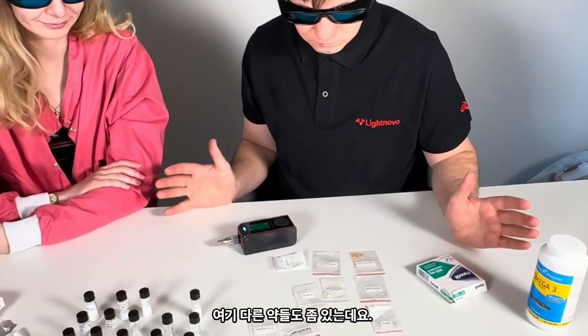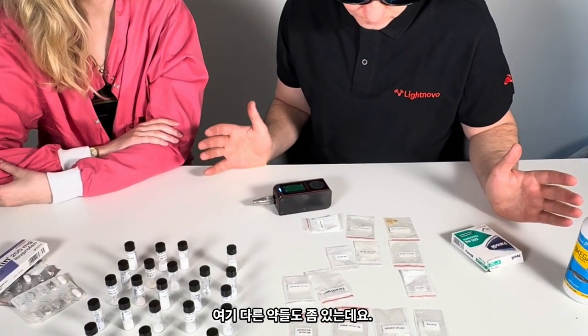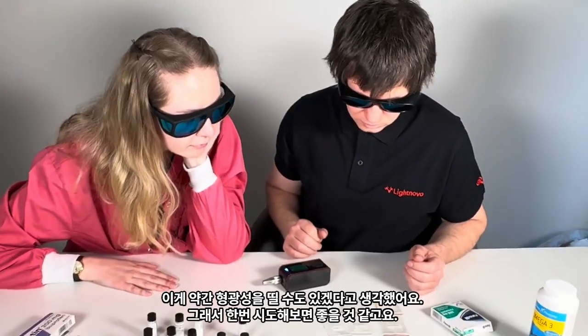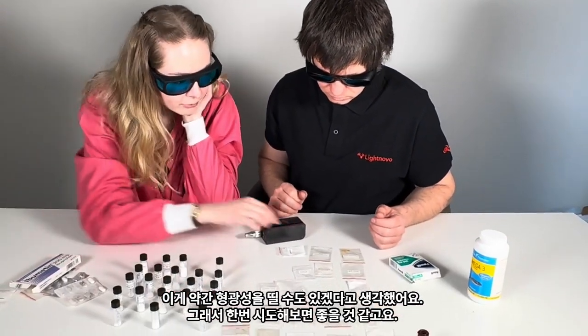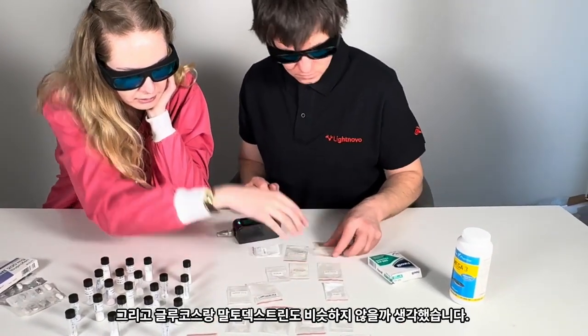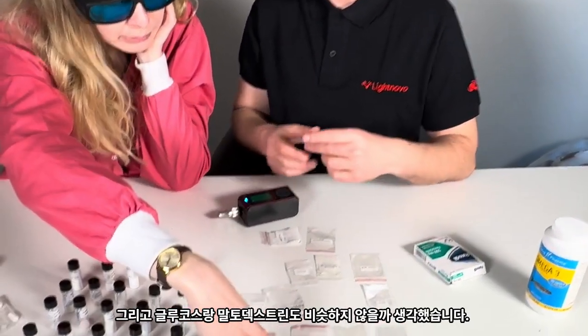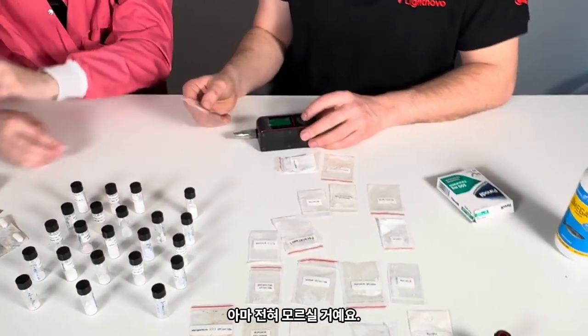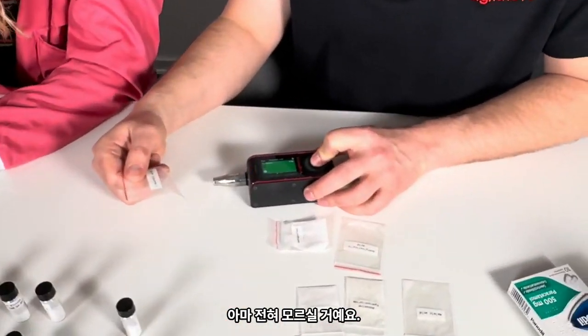Some other drugs from here. I don't know. Do you like anything in this one? From the powders? Yeah. I was thinking this might be a bit fluorescent, so we might try this. And I was thinking also glucose and maltodextrin should be similar, right? Probably, have no idea. So, ascorbic acid.